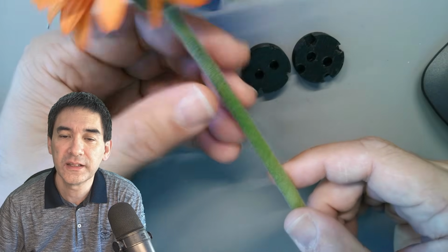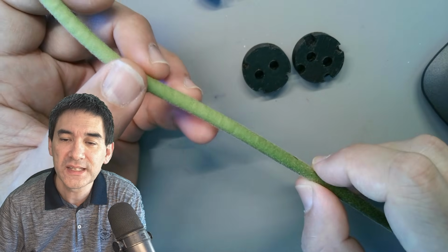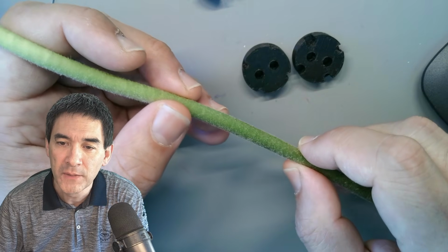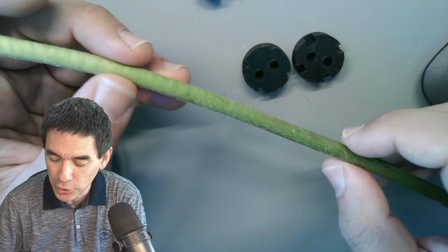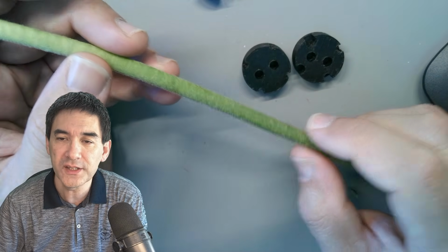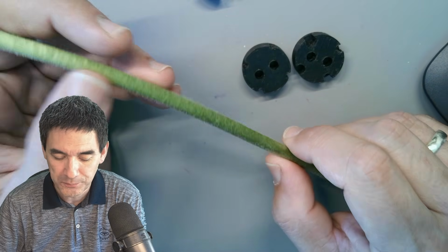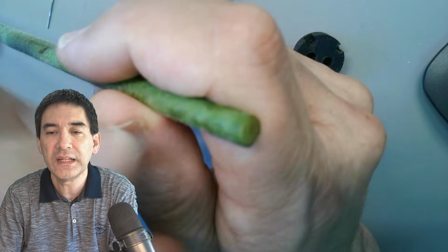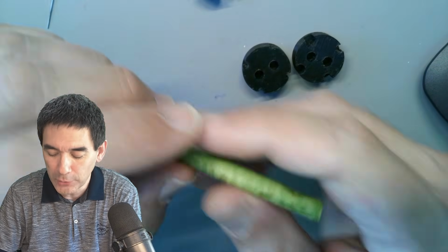And it looks like this, and it's very suitable because the stem itself is not lignified. Lignified means it's woody, so it's fairly soft, so I should be able to cut it reasonably well. And I would like to make a cross-section of this and then put it under the microscope. Okay. There's something interesting that I did notice, and that is if you look at the end here, the stem seems to be a little bit hollow.